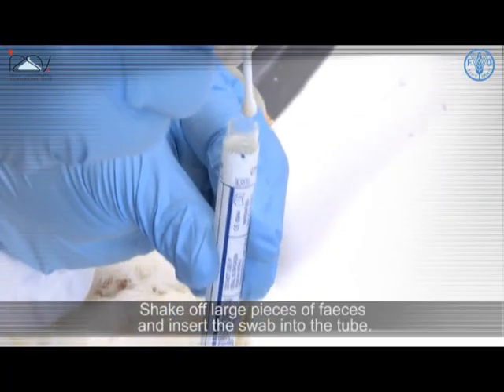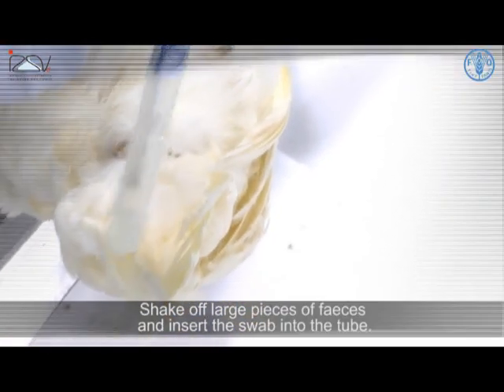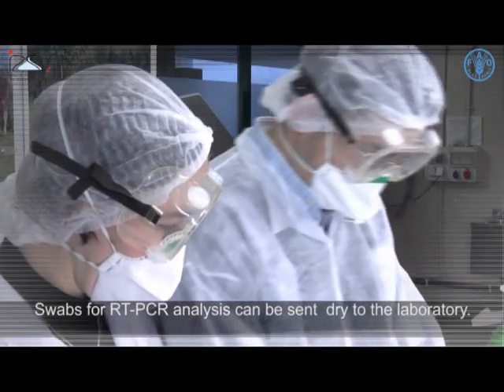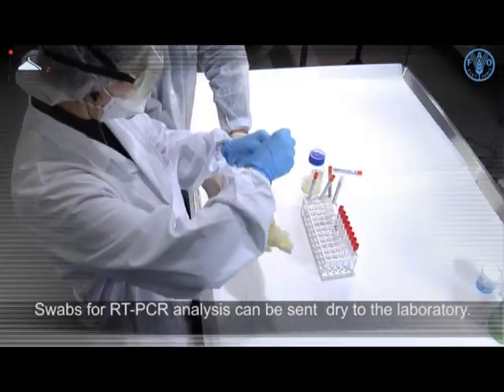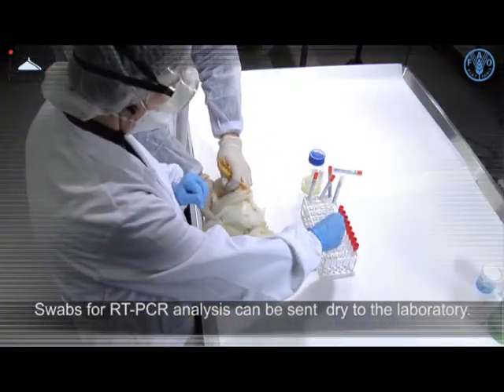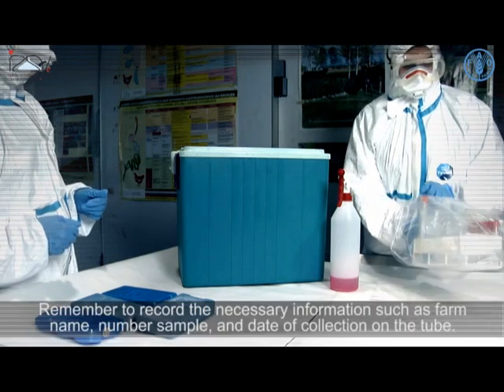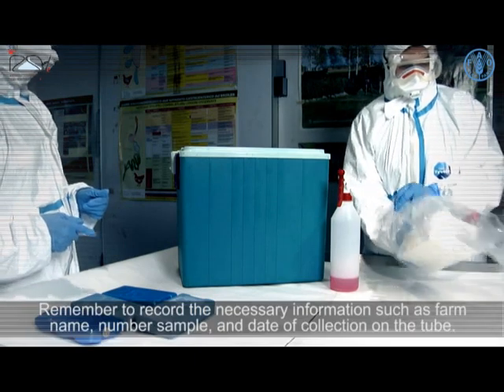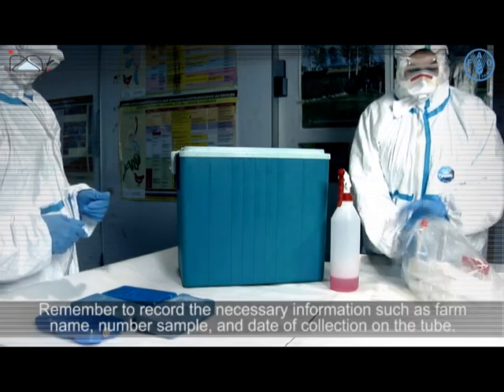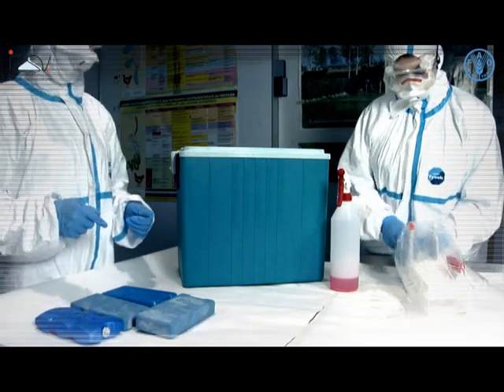Shake off large pieces of feces and insert the swab into the tube. Swabs for RT-PCR analysis can be sent dry to the lab. Remember to record the necessary information such as farm name, sample number, and date of collection on the tube.